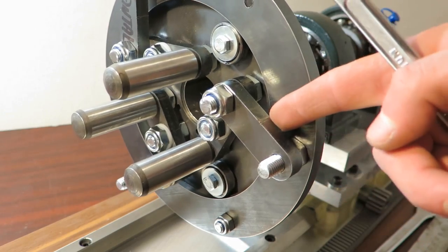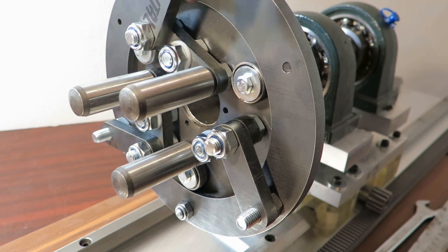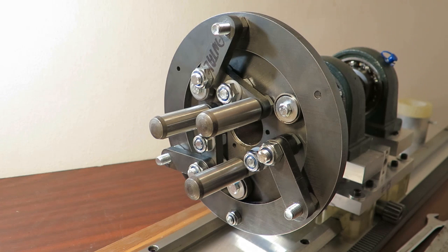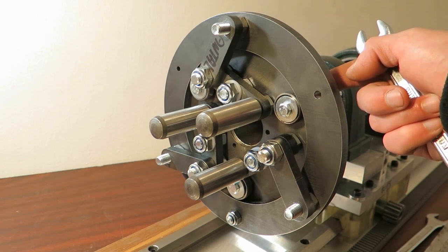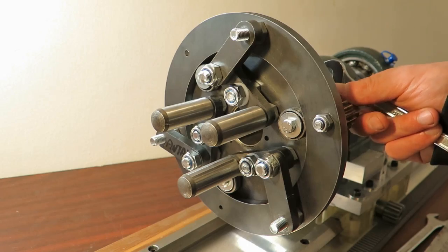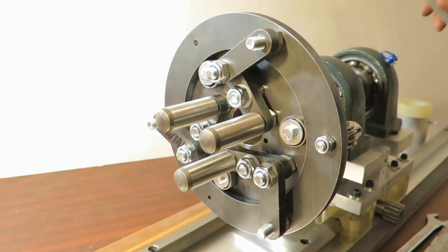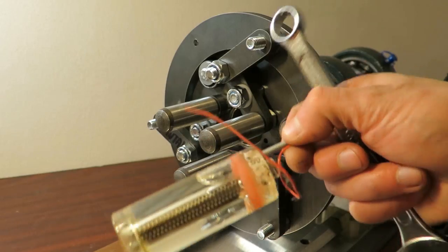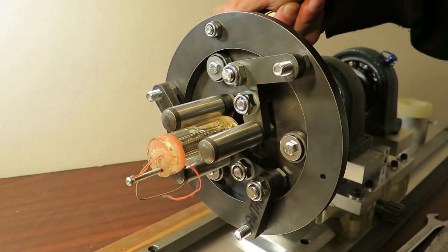And as long as this will not come off, this ring will also not come off, so that's why I have plain bearings there, basically. Basically everything here, the diameters, lengths and so on, is not changed from my original design. The only thing I changed is that I am using a spur gear as a back plate, and a pinion to actuate these arms, basically. Maybe I can put some glass into the jaws. I have only this piece left right now, so it's sitting there quite a long time, basically.